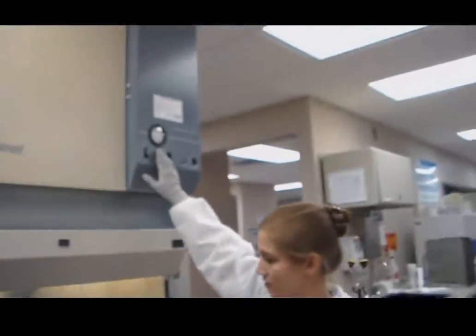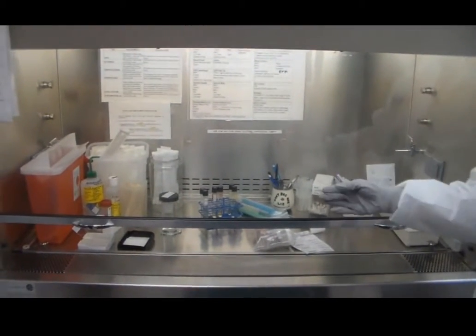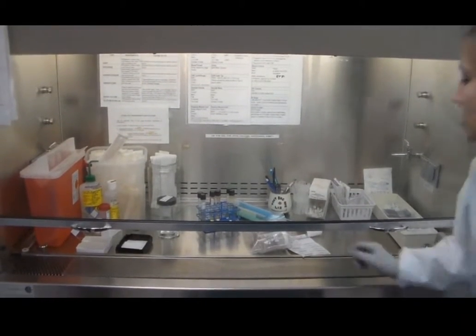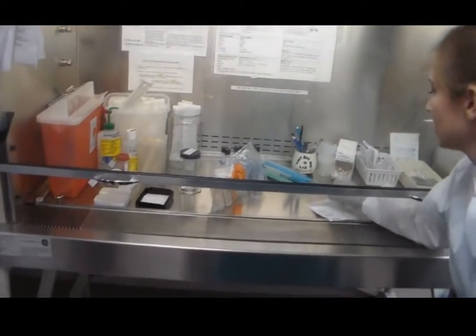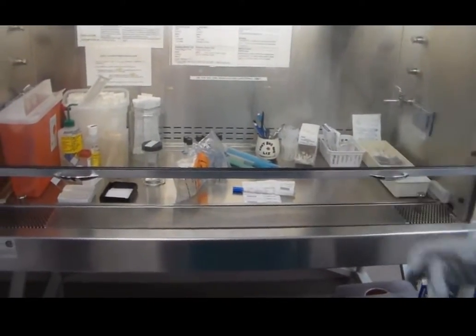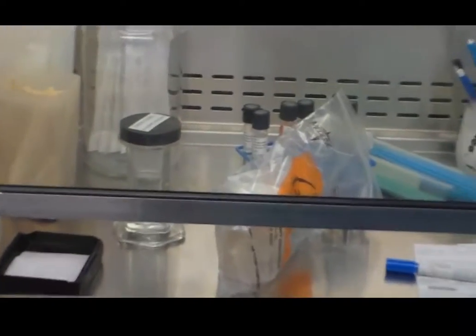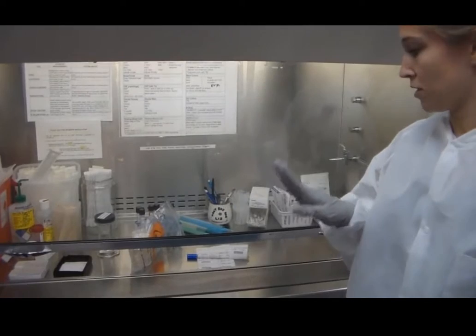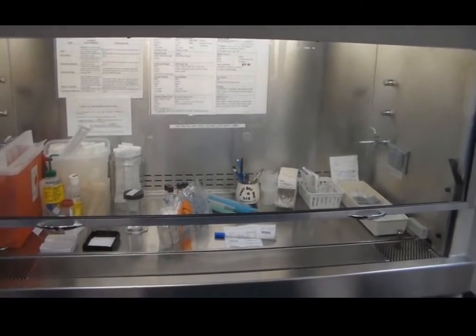This is our biosafety cabinet. This is where, when specimens come in, they'll be set under here, ready to be set up on those plates that I was showing you. For example, here's a sputum, and here's a wound culture. Whenever I get something like that, I'll grab the plates that are appropriate for it, and I will swab and streak for isolation. We use a 4-zone isolation streak. So that's what this is.